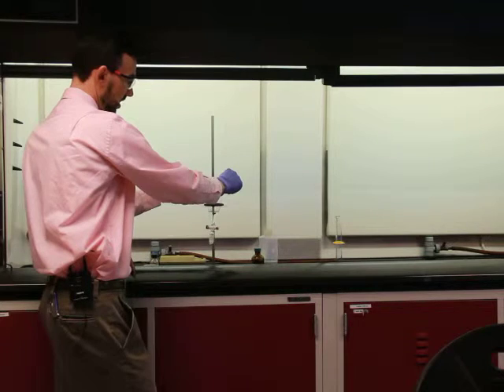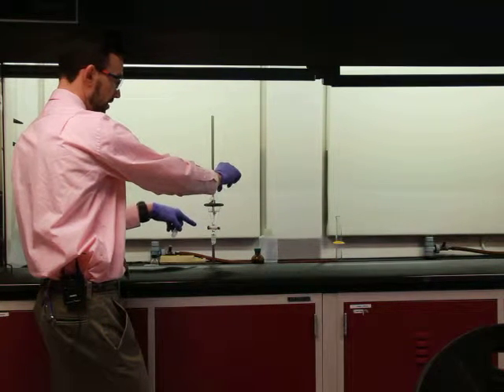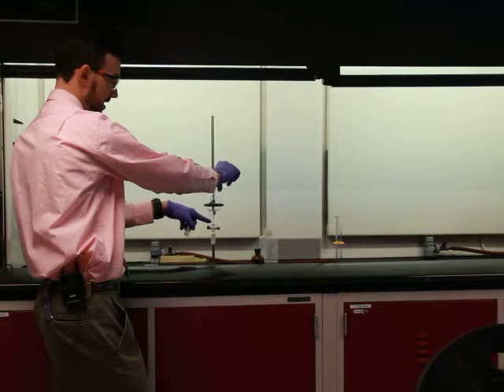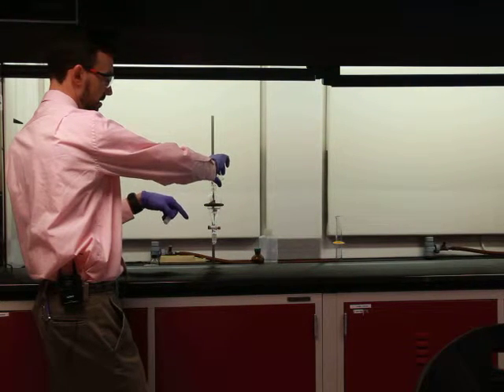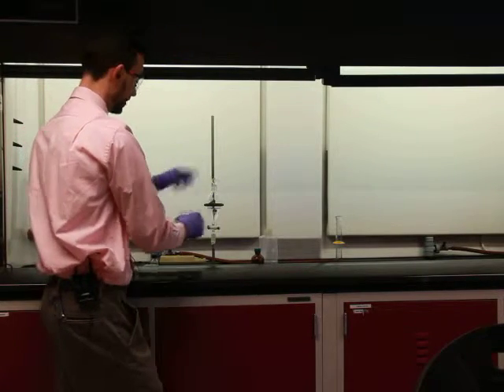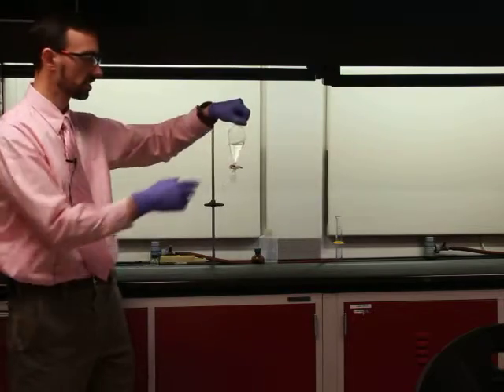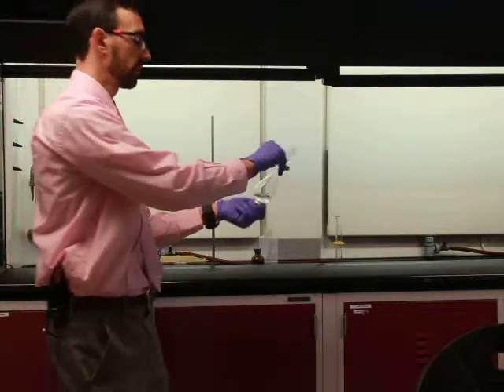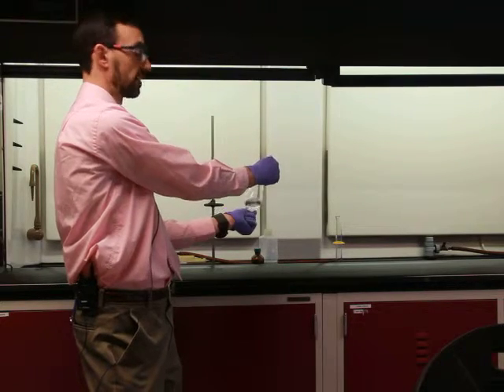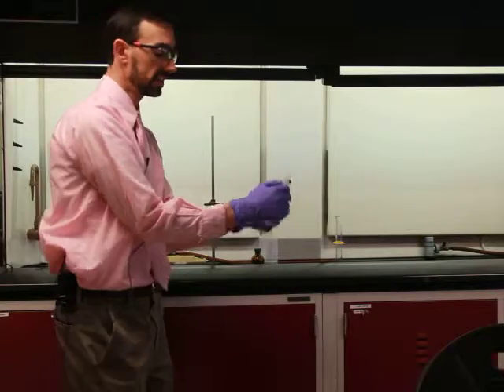Okay. Now watch carefully. You should be able to see this will sink down through to the bottom. It's going to go down to the bottom, all right, and then the ether pushes up on top. Okay. All right. Now we're not seeing much or anything. These are all invisible. I could have used one of the colored unknowns, and we would have seen this a little bit better. But right now we've got two layers. All right, there we go. Generate a little more pressure now. Okay, you heard that.